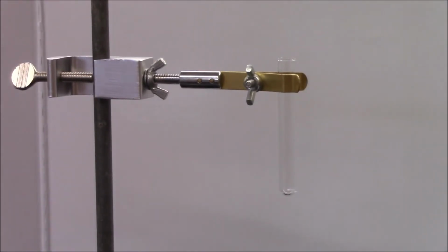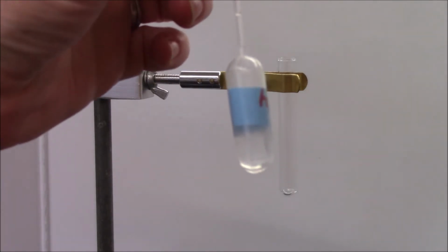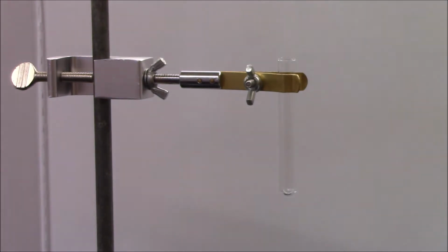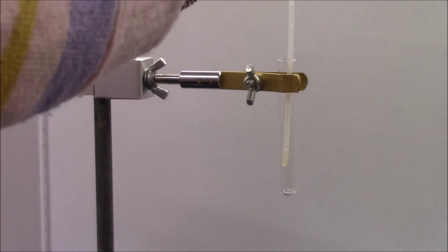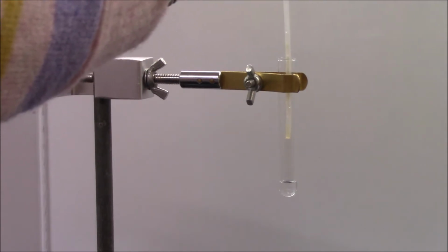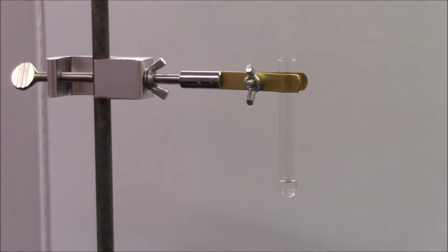Alrighty guys, I'm going to carry out each of these reactions in this small test tube that you see suspended in front of you. In the first reaction, I'm going to be mixing potassium sulfate, K2SO4. If I hold it here and you look in, it's clear and colorless. I'll add some drops to the bottom. There you go. Again, you can see in the bottom that it is clear and colorless.